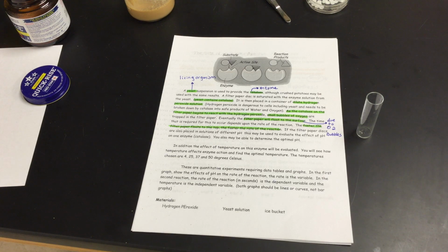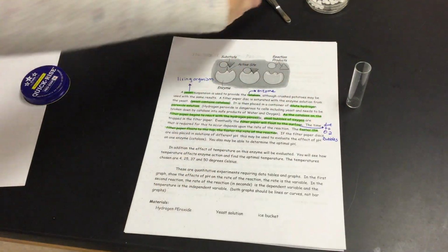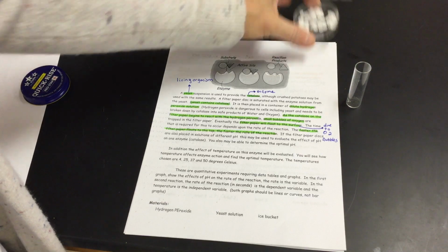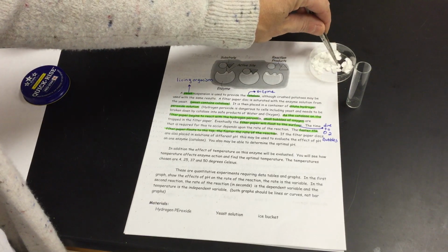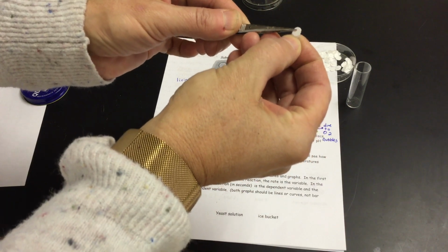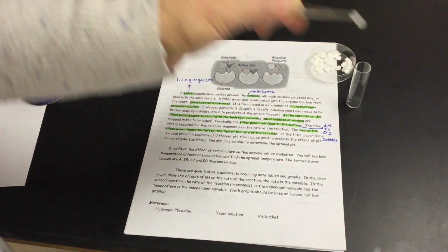So how do we know that my yeast is physically doing its job? When I fill this little tube with my particular solutions that have hydrogen peroxide in them and their little pHs, I'm going to put yeast within it, but I'm going to do it using this little piece of filter paper. I have these little discs here of filter paper, and we want to make sure we only grab one at a time, otherwise it's going to change the mass of what's going in there.